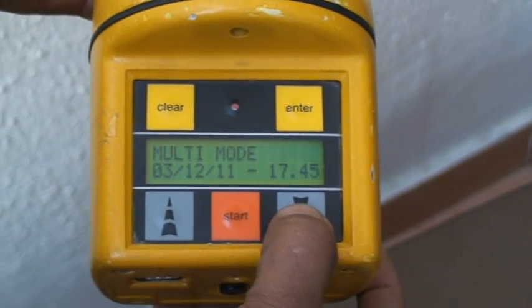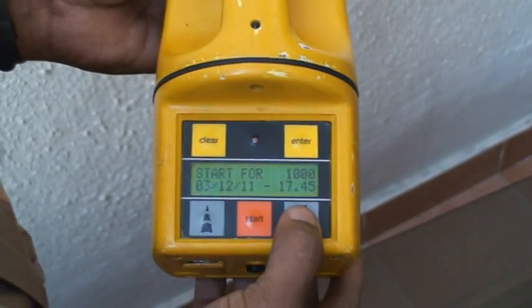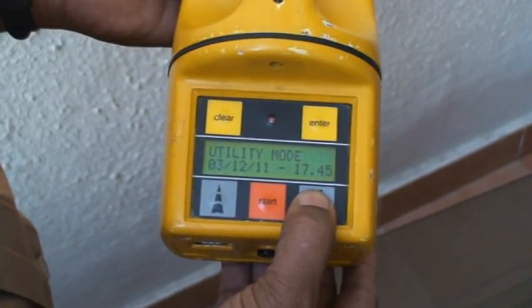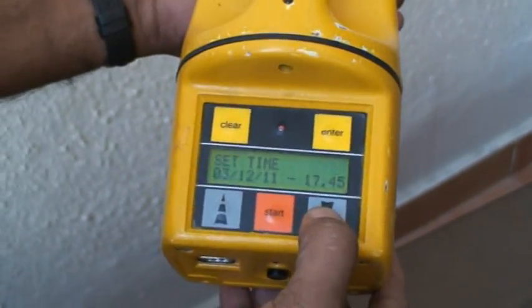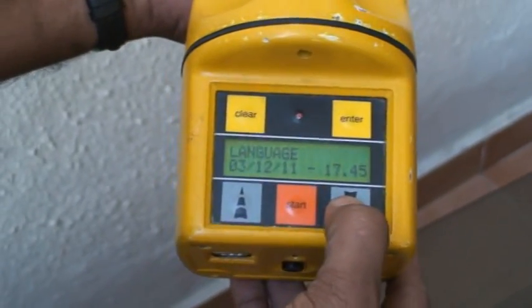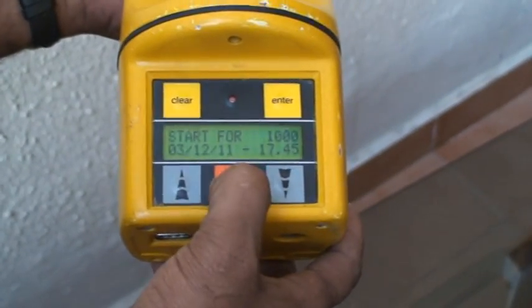Then there is multi mode, where you can set the time interval between each sampling and program the sampling interval. The utility mode allows you to configure time, display, and other user settings, such as print, display record, and clear record — all related to electronics configuration. That covers all the main modes.